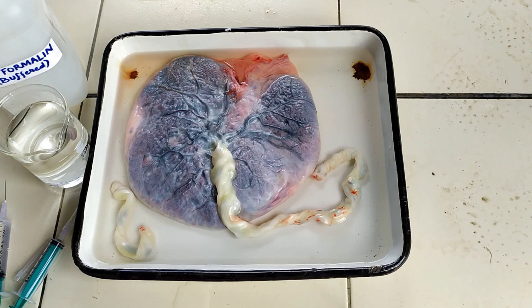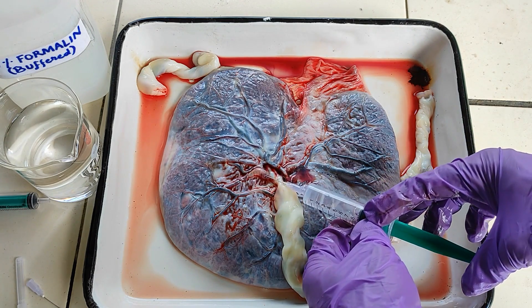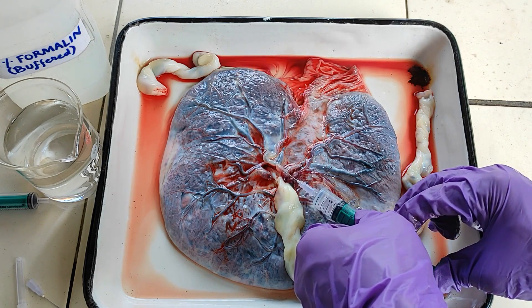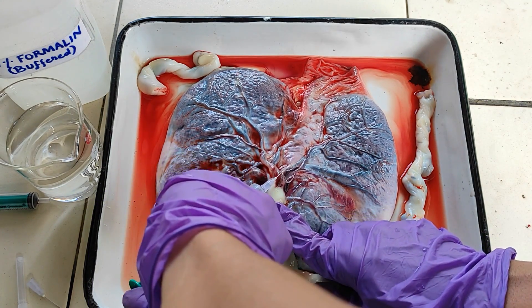To begin the injection, spread the placenta or the organ on a shallow tray. Using a standard injection syringe with a 24-gauge or so needle size, start injecting 2–5 ml each of 8% concentration of preferably buffered formalin at several points throughout the placenta. Make sure to also inject a good amount of the fixative into the larger umbilical arteries and veins, especially in and around the point where the umbilical cord attaches to the placenta.